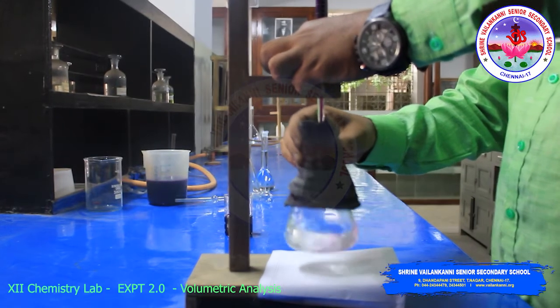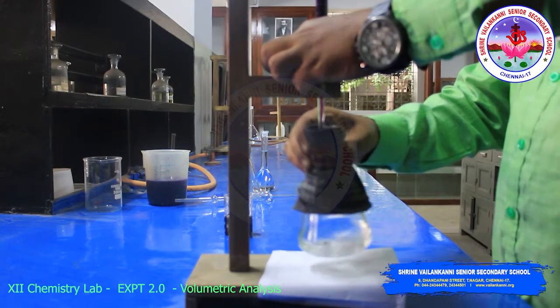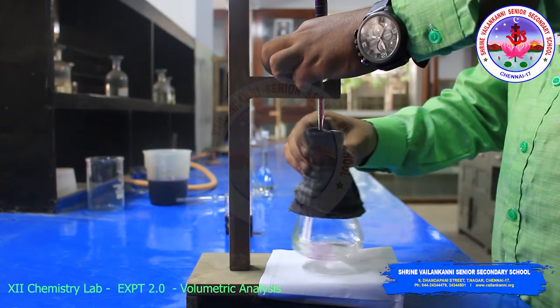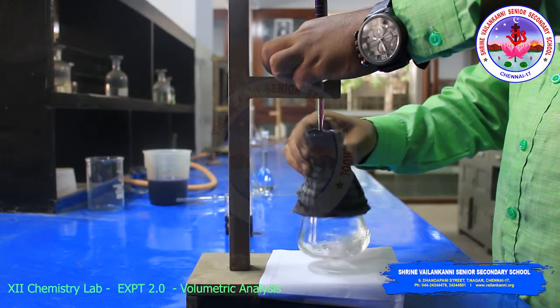Once the potassium permanganate solution contacts this solution, look, immediately it shows the pink color, but after stirring it disappears. The pink color should not change, that is the end point.